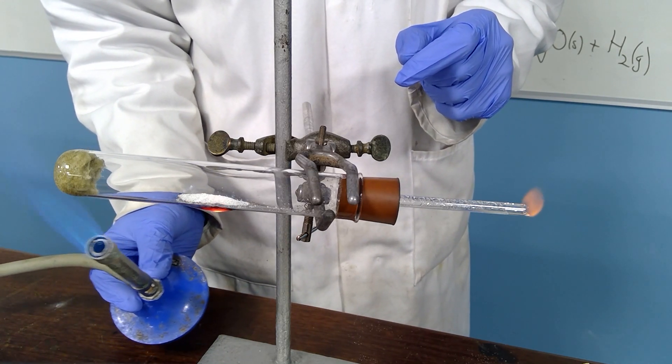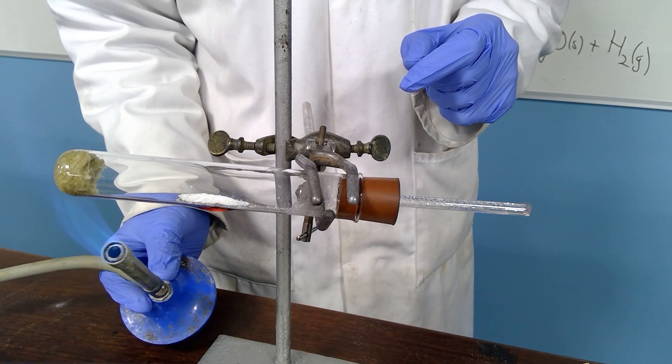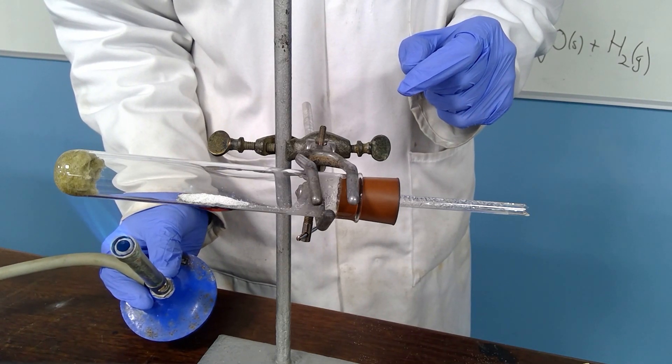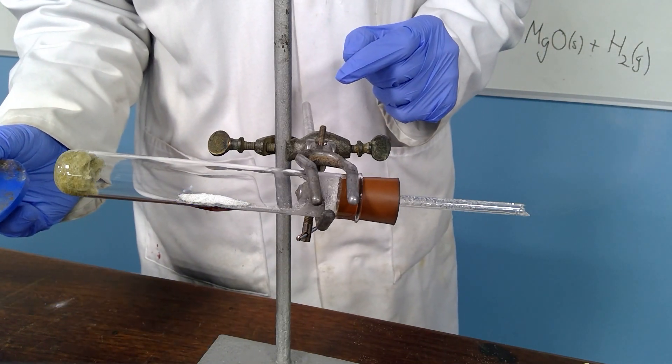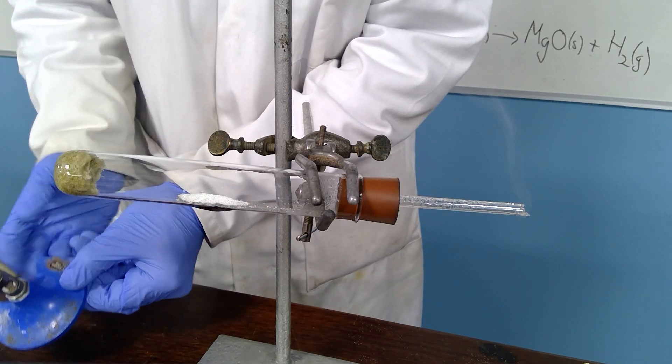Eventually the reaction will subside, although when I heat the water you can still see a little bit of a flame. And finally, the reaction has probably finished.